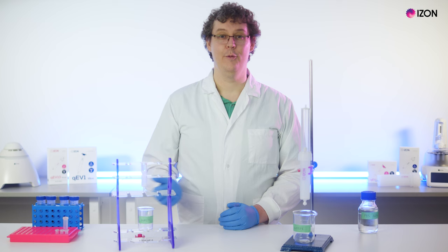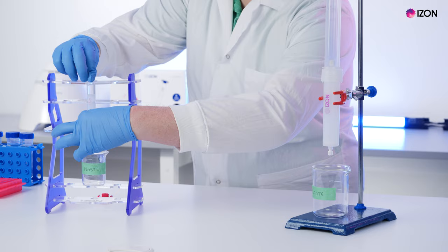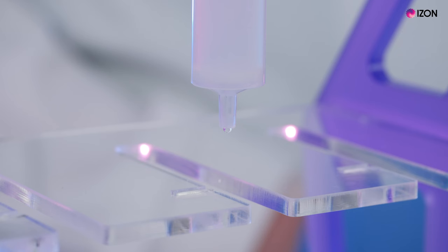If you remove the lower cap first, you will damage the column when the upper cap is removed. With the waste beaker in place to collect the fluid, remove the lower cap.